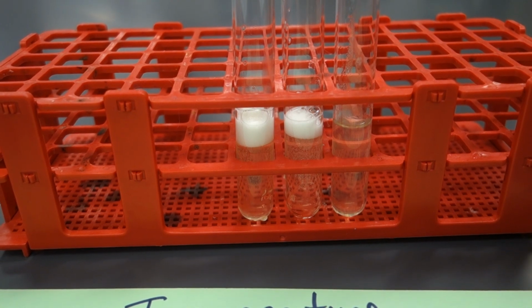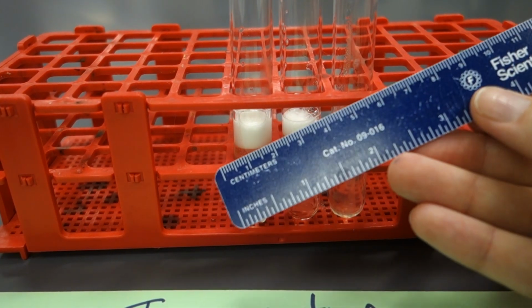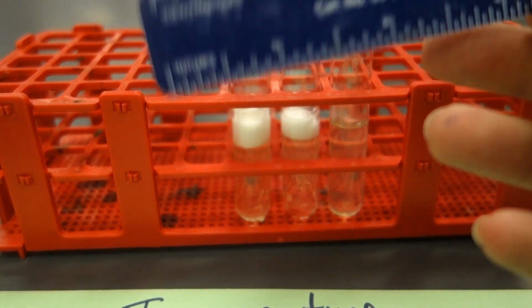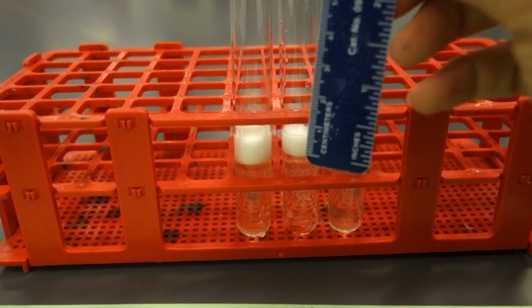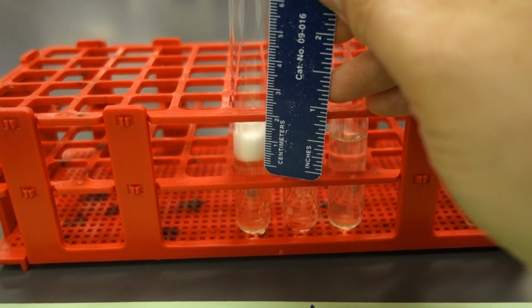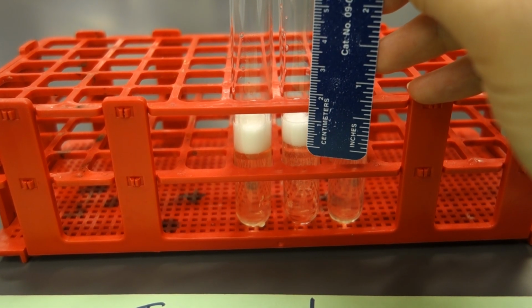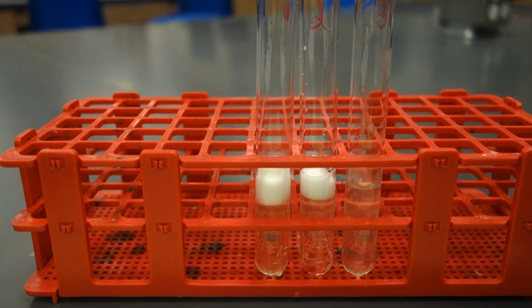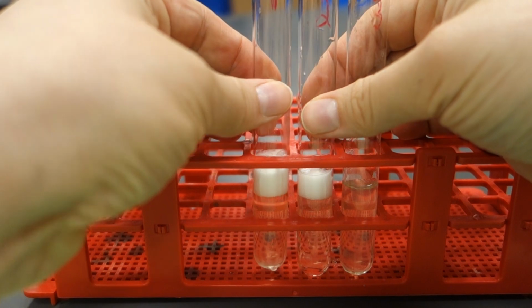So as we watch this go, what you will be doing in lab is taking a trusty dusty calculator. I just call this calculator. This is called a measuring stick. A ruler, oh my goodness. So you will be measuring how many bubbles are actually made here. All right, so how many bubbles are made from the top of the fluid to the top? And again, you're gonna do this in 20 seconds. So I'm not gonna make this super scientific right now. You will be measuring these in lab.